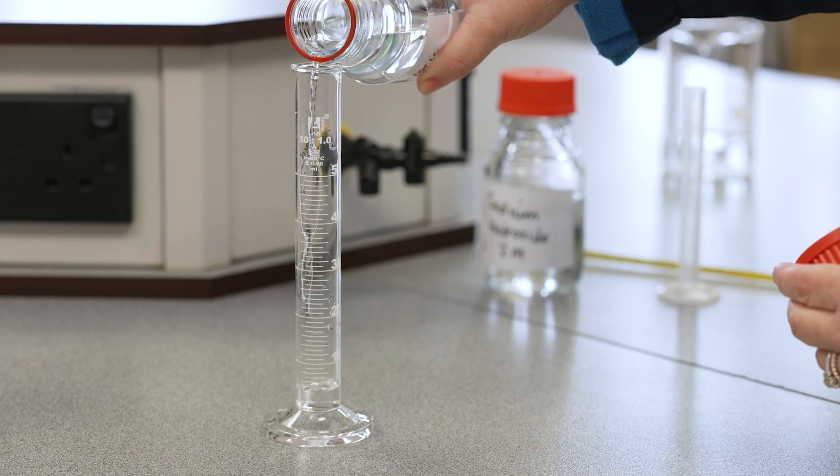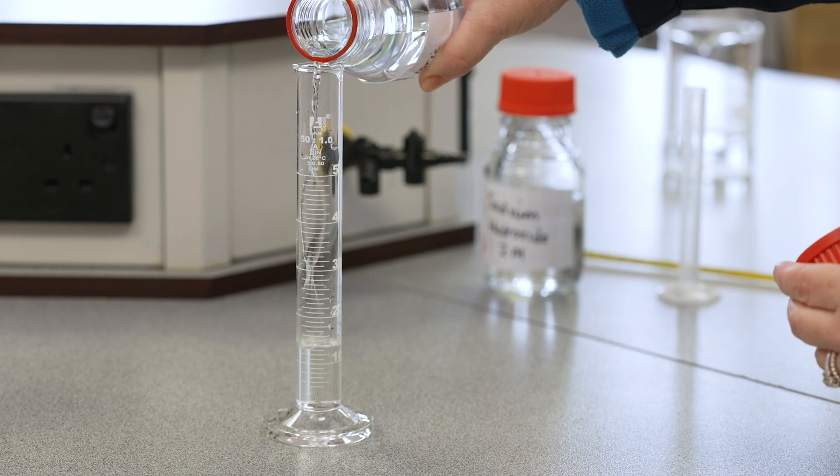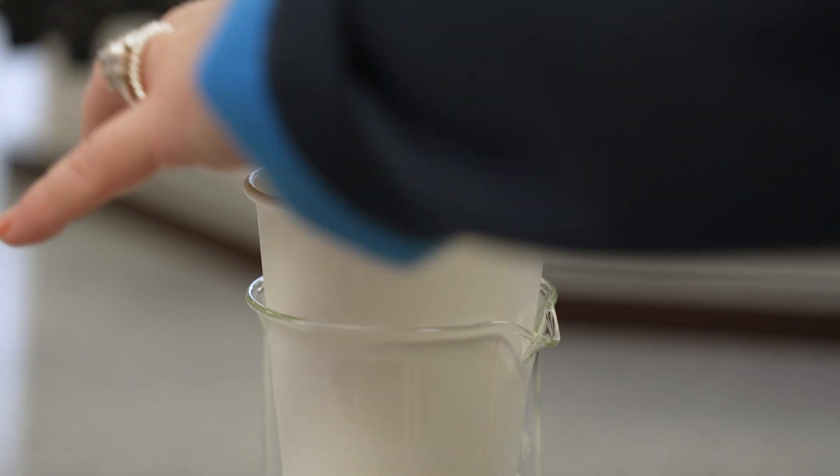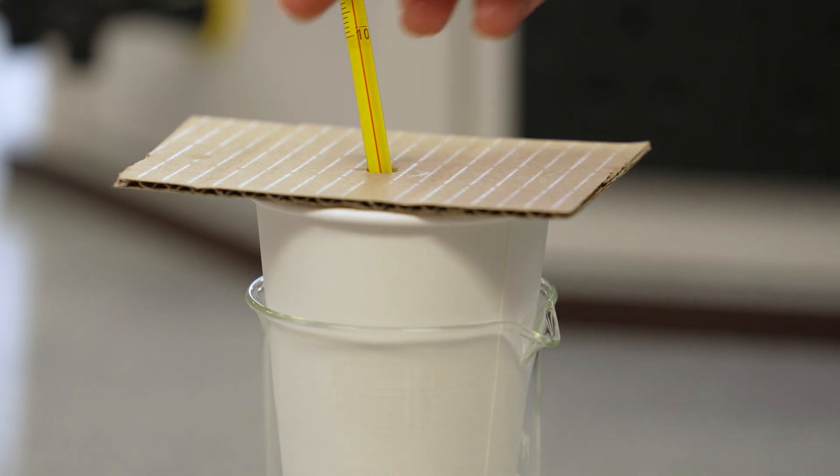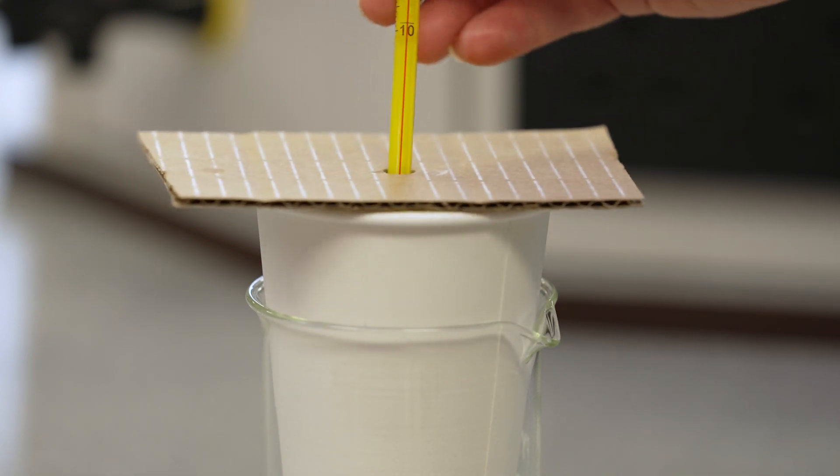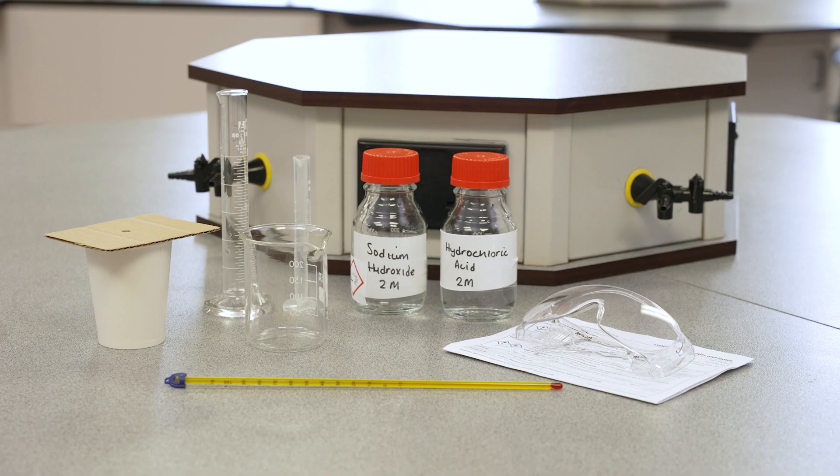They will look at the reaction between hydrochloric acid and sodium hydroxide, measuring the change in temperature and then plotting a graph of their results.